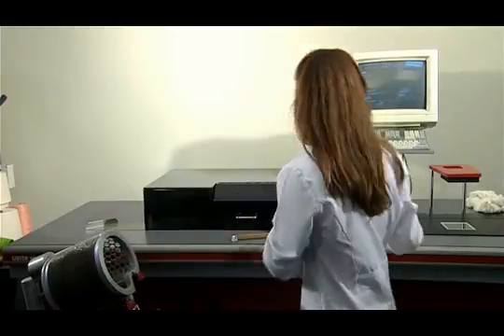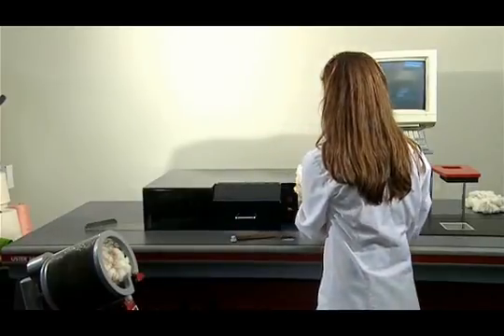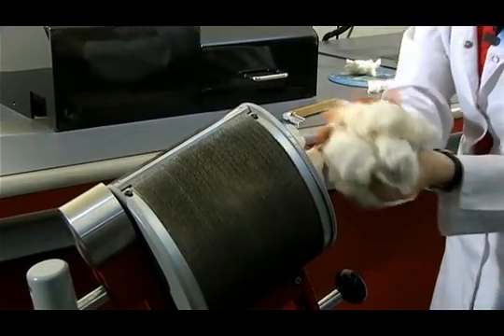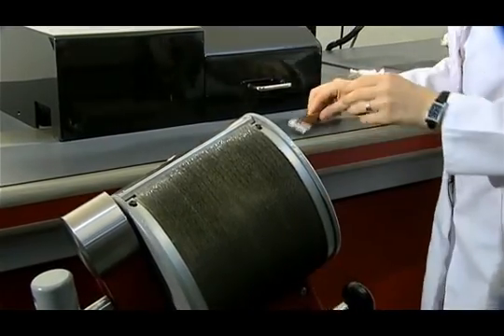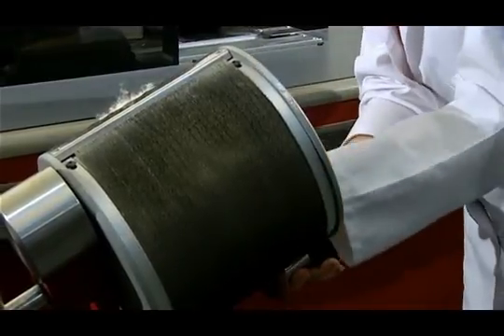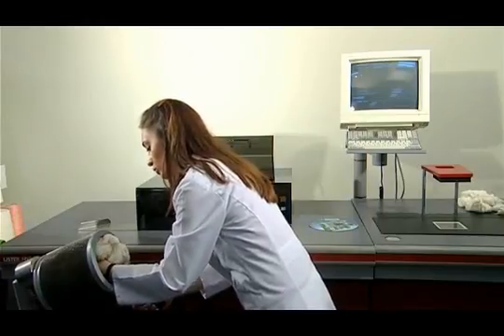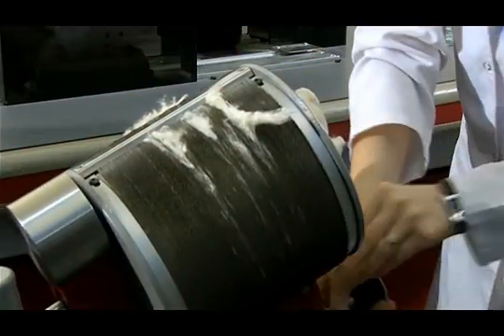We primarily need to prepare our sample in order to perform the test with the HVI device. We use the fiber sampler for this. We place the fiber into the fiber sampler. Then, in order to prepare the sample, I am putting the sample holder into the fiber sampler in a closed position. While I am turning the handle one complete turn with one hand, I am pushing with my other hand in such a way that the fibers protrude. After closing immediately, I remove them in this way.